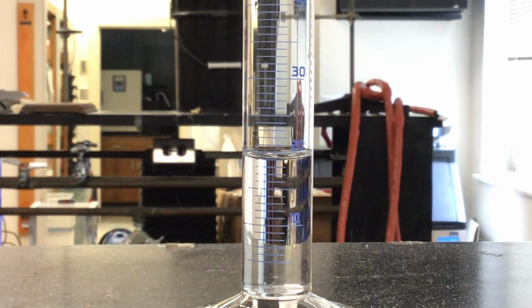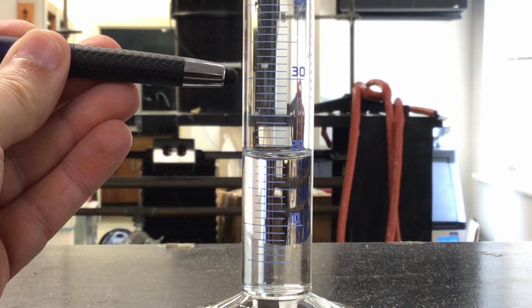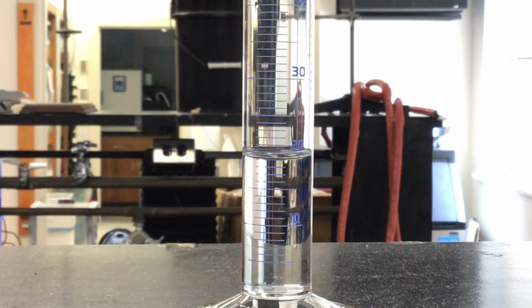All right, so swapping from length to measurements with volume now, we're going to look at some of our different measuring tools for volume, starting with the graduated cylinder that we see here. Graduated cylinders are a little more accurate than what we're going to see out of beakers and flasks. But the number of significant digits we report is still dependent on where our calibration marks are for that particular graduated cylinder. We'll notice here it ranges from, say, 20 up to 30 cubic centimeters or milliliters, which are the same unit. So the tick mark is basically every 1 milliliter.